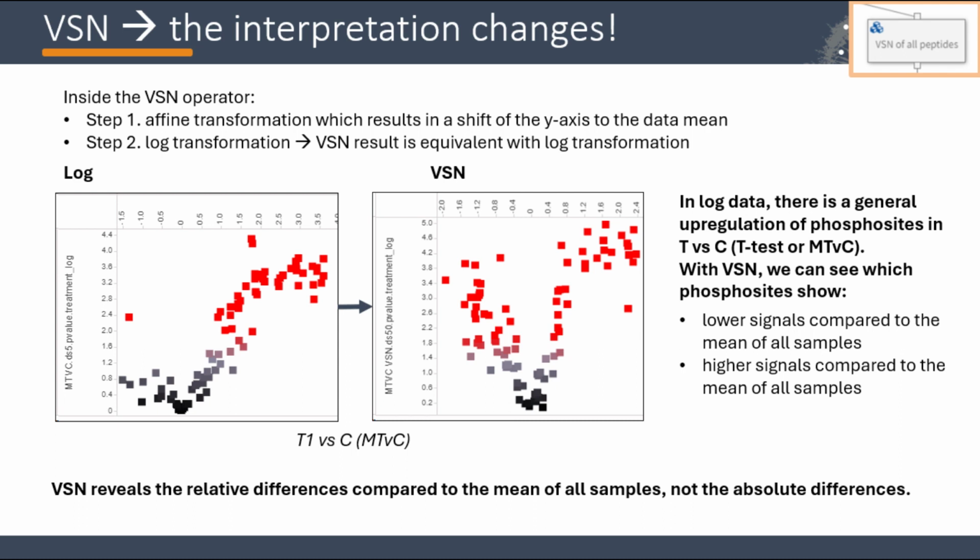Let's take a dataset for which a t-test after log reveals a general upregulation of phosphosites in test versus control. If we do a VSN on this data, a subsequent t-test would result in a V-shaped volcano plot. Here, we can see which phosphosites show lower or higher signals compared to the mean of all samples. Thus, the fold changes we see on this plot are not the absolute fold changes, but the relative fold changes compared to the mean of all samples. Additionally, VSN is equivalent to a log transformation, thus its output data is on log scale.